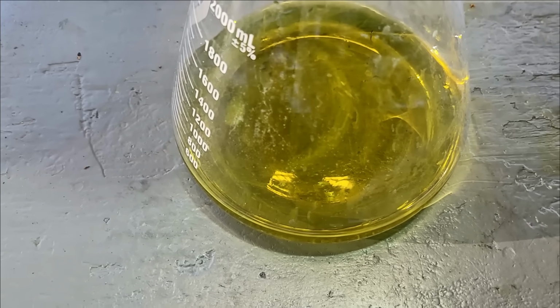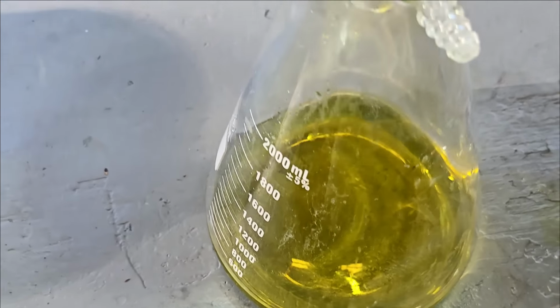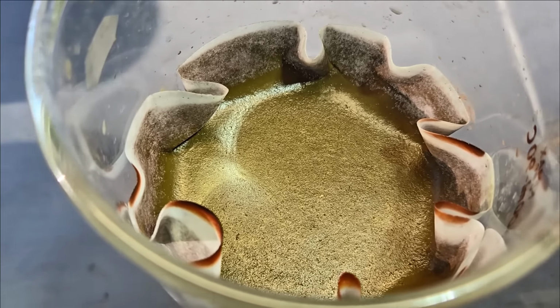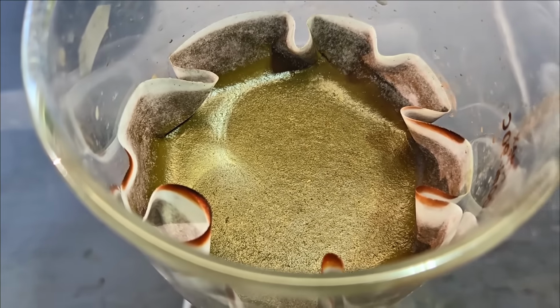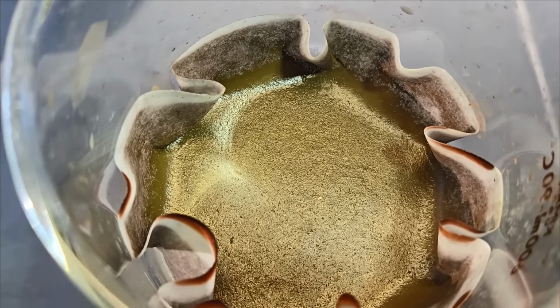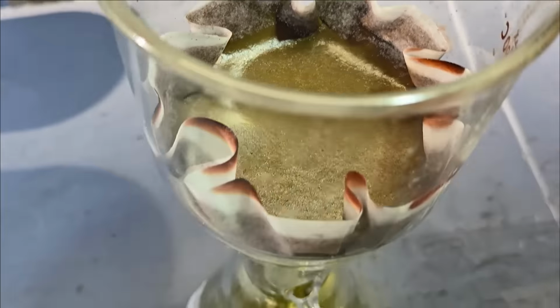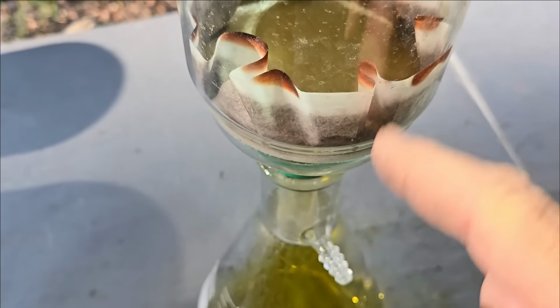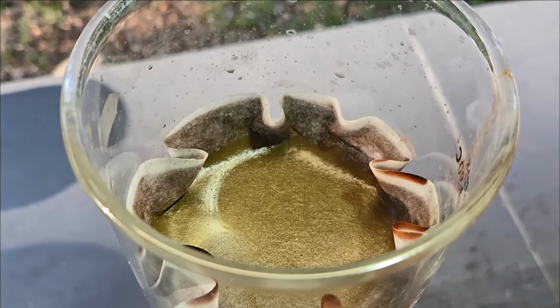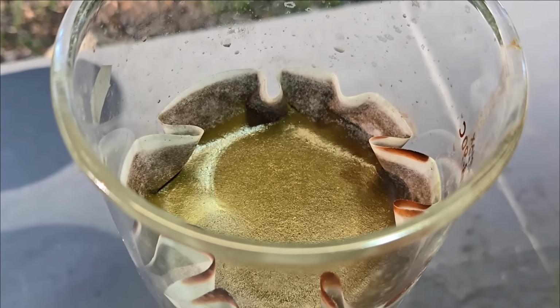All right, I have run this acid through twice, and it's gotten quite yellow-green. I just picked up whatever was in here. I'm sure there was a lot of copper and tin, maybe some other stuff too. But what's left should be pretty much just gold. I'm gonna put a bunch of distilled water through just to get the green stuff out of it. And then we'll be ready to go to Aqua Regia and try and dissolve the gold out of here.